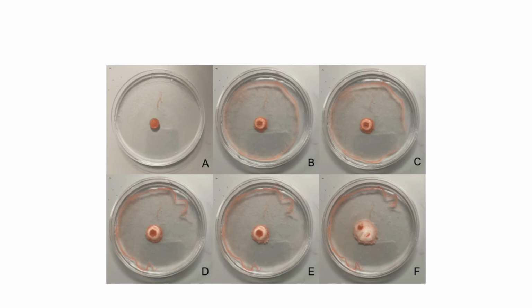In our experiment, a weak base was chosen to model the conditions of the small intestine. This time lapse shows a 200 milligram tablet of ibuprofen dissolving in a 5% weight potassium phosphate dibasic solution. These basic conditions model the environment of the small intestine. The red enteric coating is the first to dissolve. The coating protects the drug while it passes through the stomach until it reaches the small intestine.